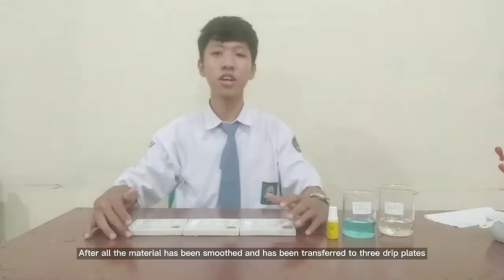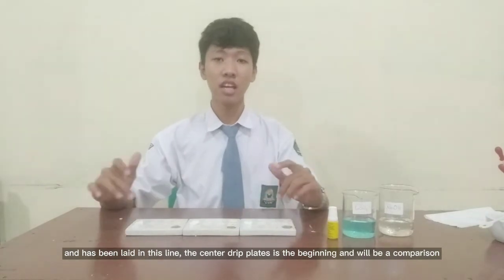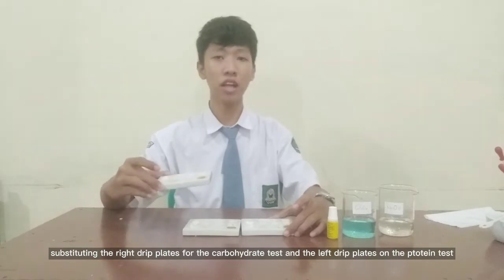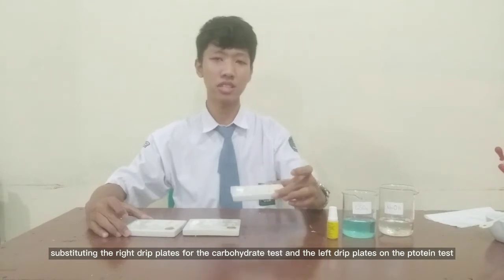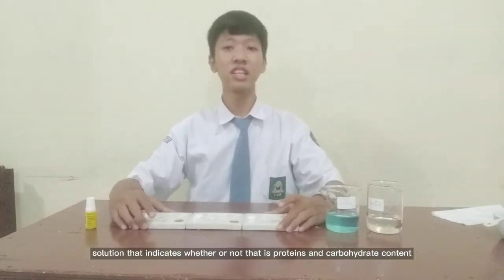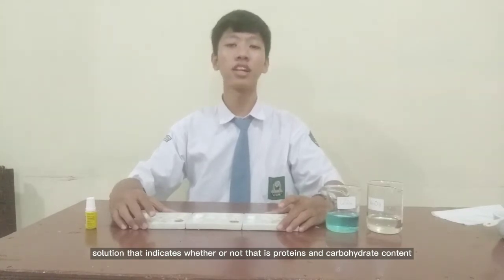After all the material has been smoothed and has been transferred to 3 drip plates and has been laid in this line, the center drip plate is the beginning and will be the comparison. The right drip plate is for the carbohydrate test and the left drip plate is for the protein test. Now we're going to drip each of these with the indicator solution that indicates whether or not there is protein or carbohydrate content.